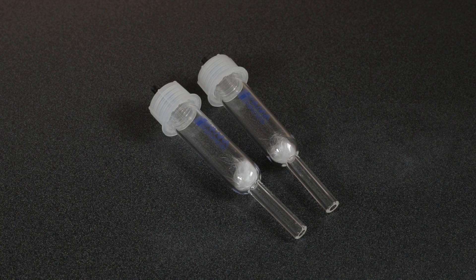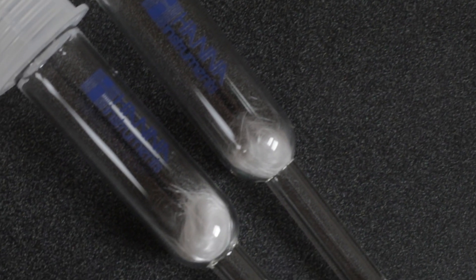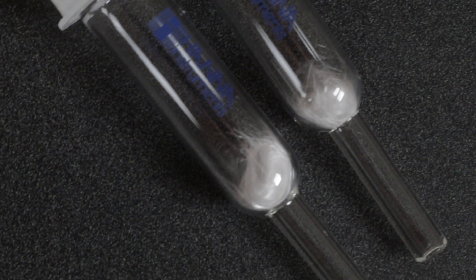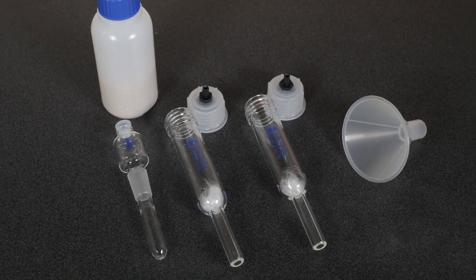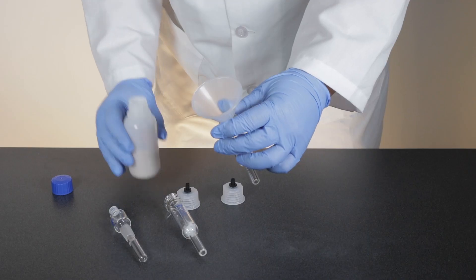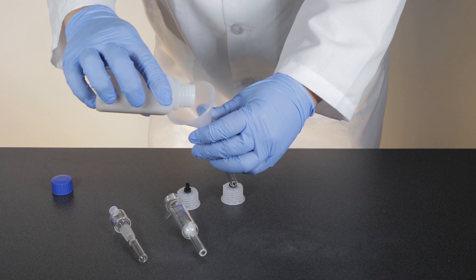We'll start by filling the desiccant cartridges. Notice the small amount of glass wool inside each cartridge. This is to keep the molecular sieves from falling out. Fill each cartridge with the supplied molecular sieves. If you have a funnel, this makes filling even easier.